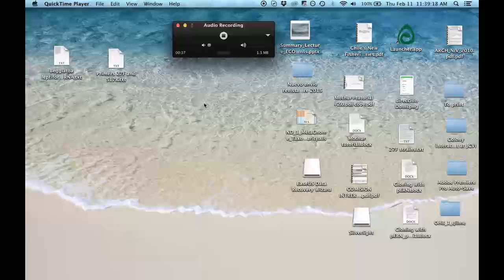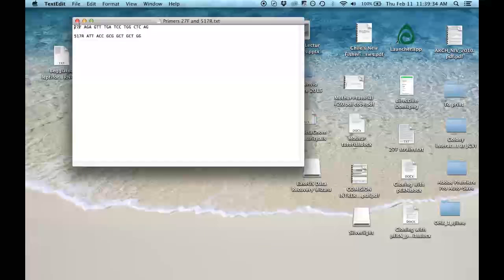In order to do that assay, you have to know first two things: the primers that you use and a reference sequence. In this case, I have ready the primers that you use for your PCR. So you use the 27F and the 517R. This is the name of the primer and the sequence of the primer. You can obtain it from the literature, from the internet, from the protocol that you are using. But you have to have it in a text file editor to copy and paste on the Geneious or in any other sequence program that you are using to analyze your sequences.